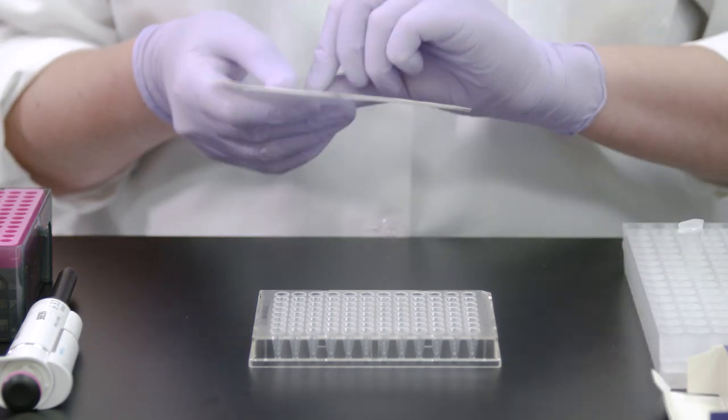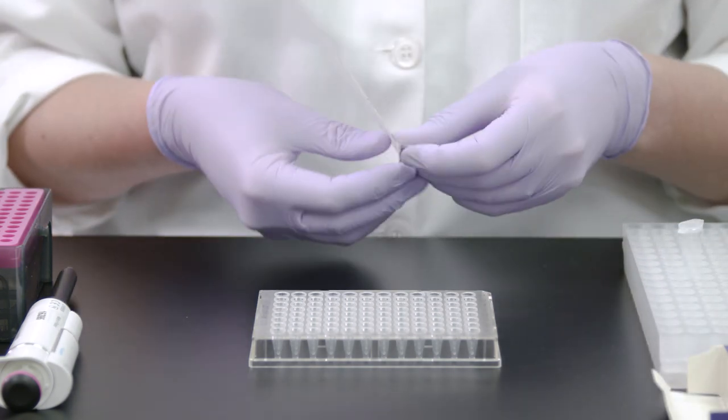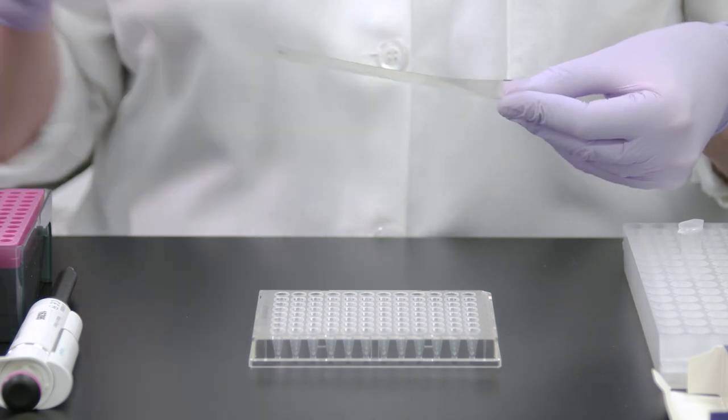After pipetting your PCR samples, remove one of the adhesive plate seals from the package and remove the backing of the adhesive film.